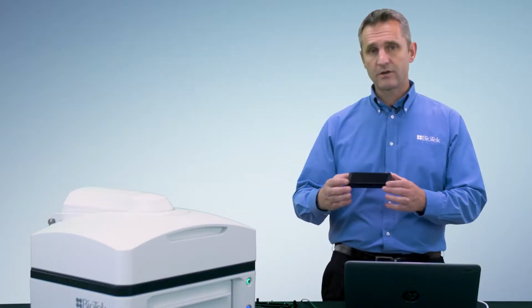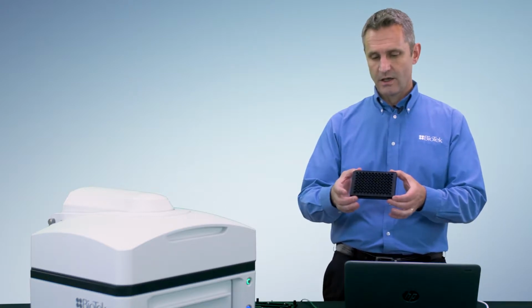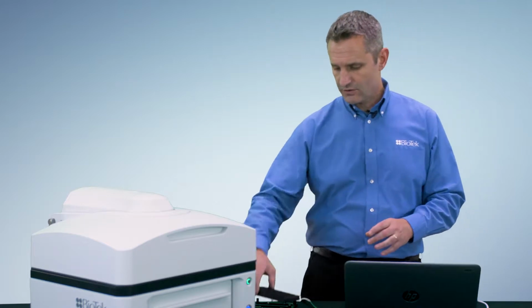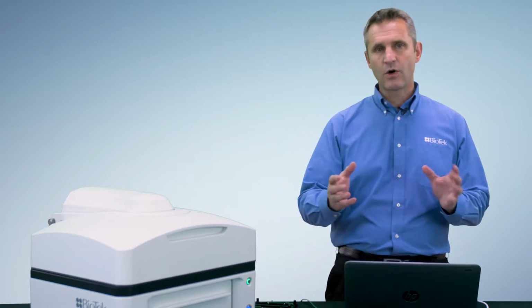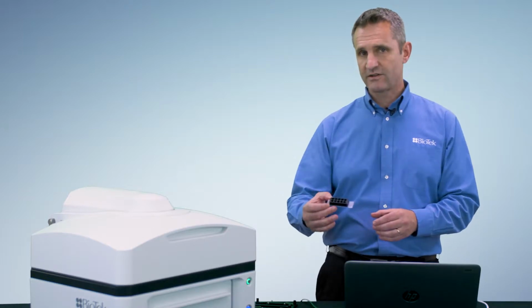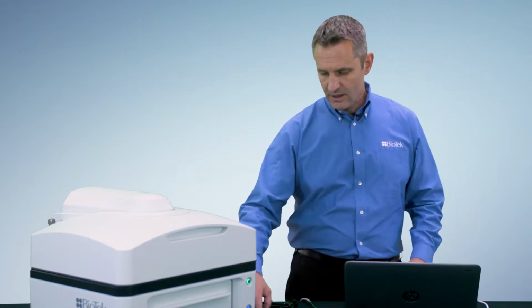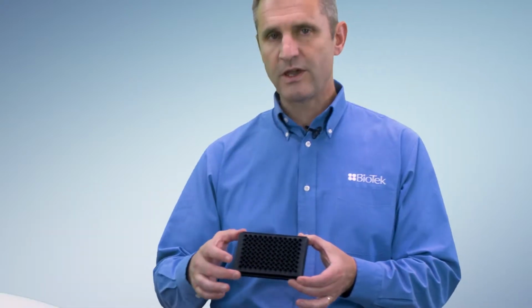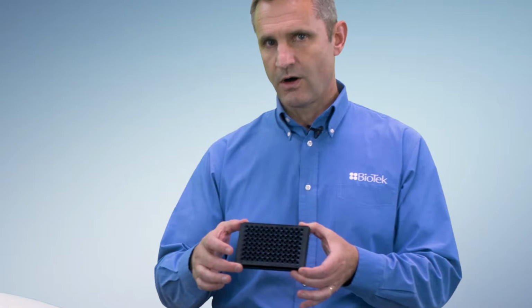So we just talked about how you define a labware like a microplate in the software. Now what I want to show you is how you would define a slightly more complex piece of labware in the software. I'm going to take this chamber slide as an example. As you can see, a microplate has a very regular pattern of wells on the surface.